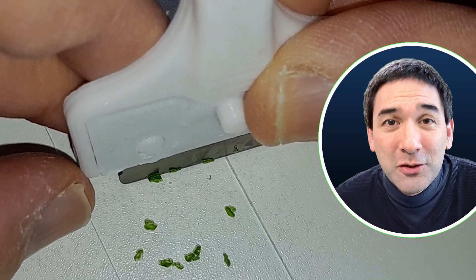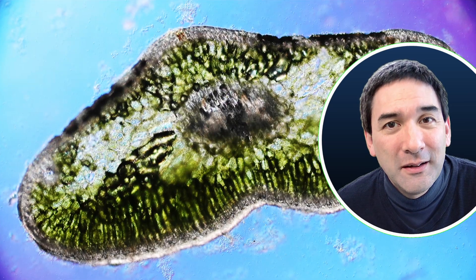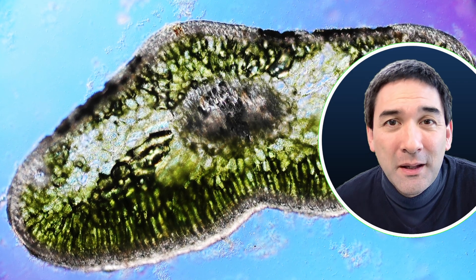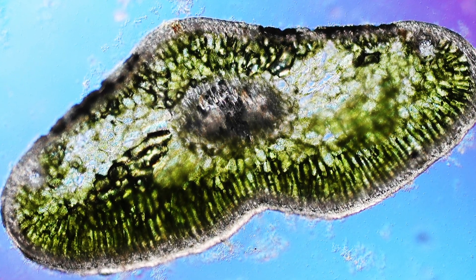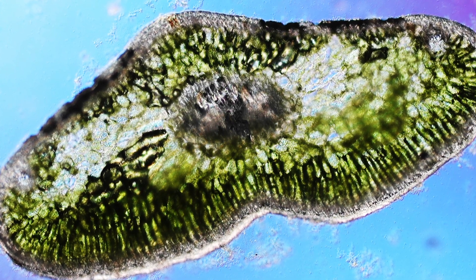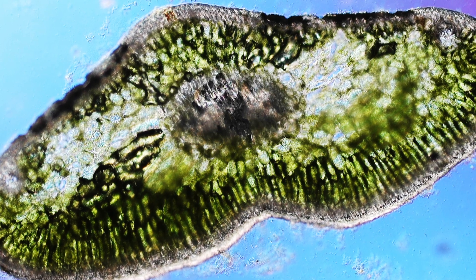I tried to make the cross-sections this time without a microtome, but rather by making very thin cuts using a razor blade. Some of the specimens were quite successful — they were thin enough. You simply have to try, and a little bit of luck plays a role here.